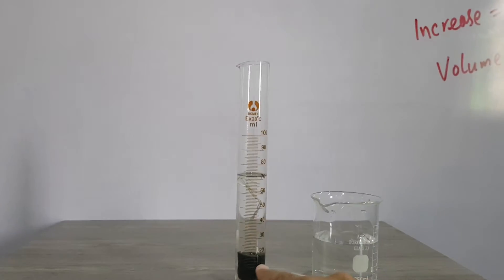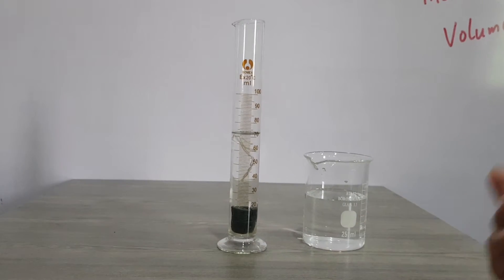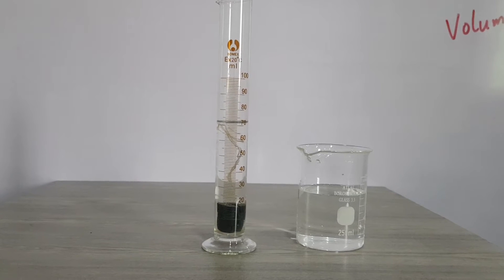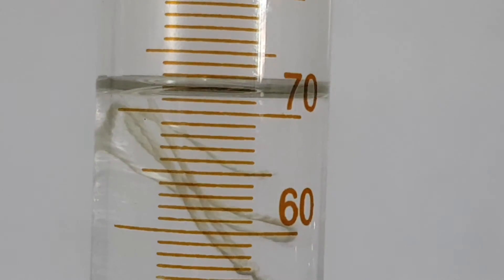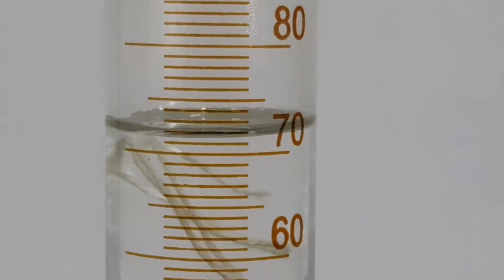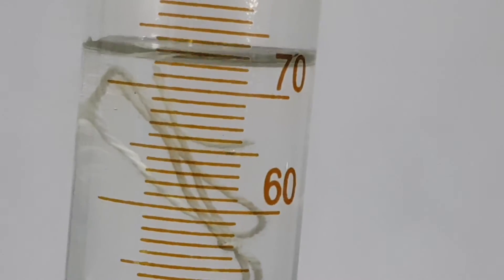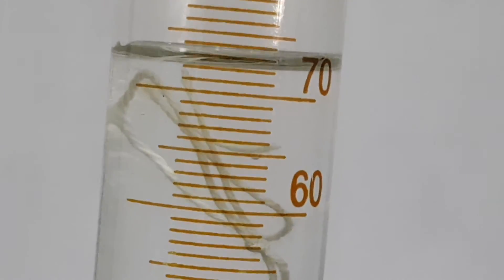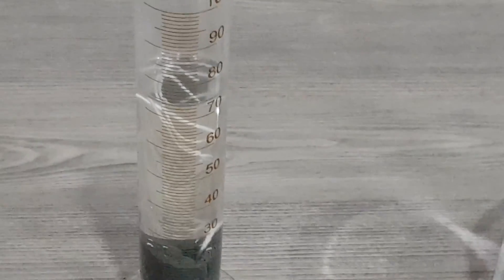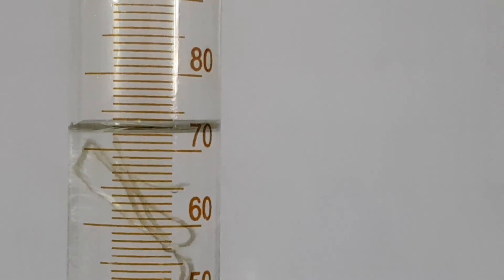After placing the cylinder, we put water into it and note the level. There are two precautions for reading the water level: there is a meniscus — a curve — and you must always note the lower portion reading, not the upper portion. Also, your eye must be at the same level as the meniscus. Bring your eye very close to the meniscus level — not looking from above or below — then take the reading.